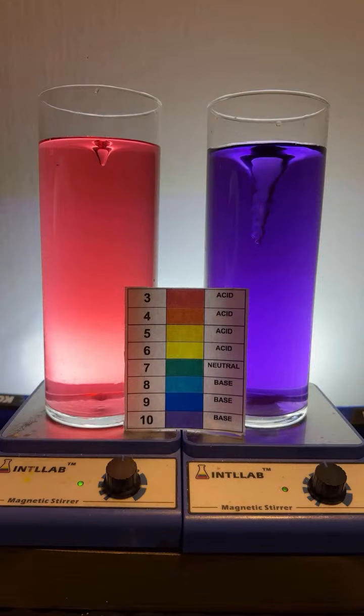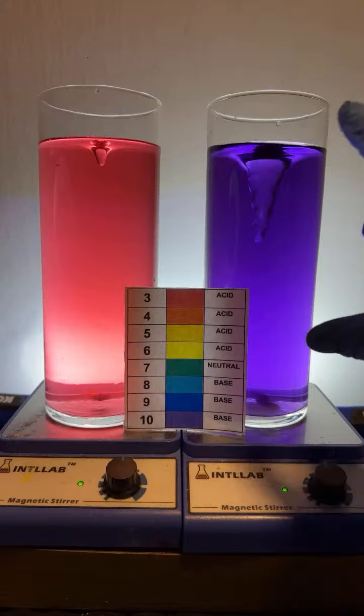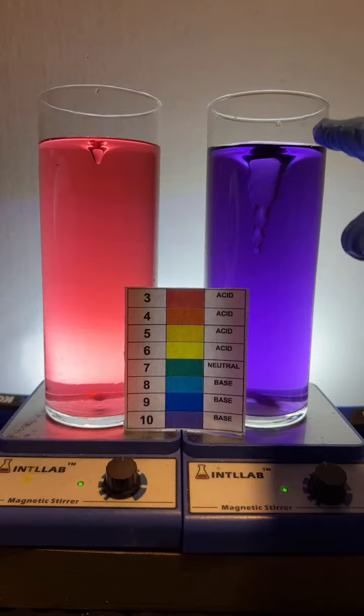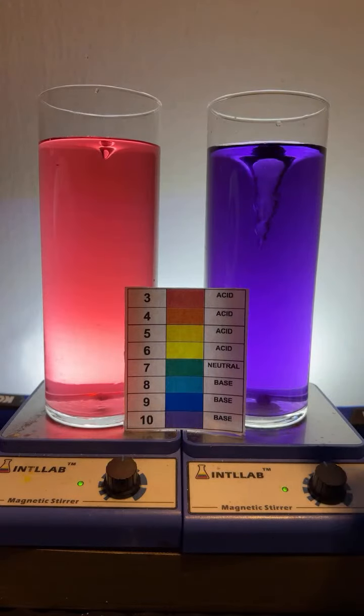Thank you, Anton. Why is the water divided into layers when it's not stirred? Here's why I think. I should create the effect again. Let me do this first, Anton, and then I'll try to answer your question.